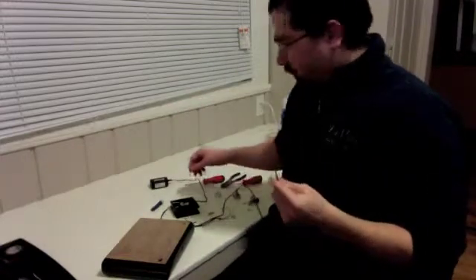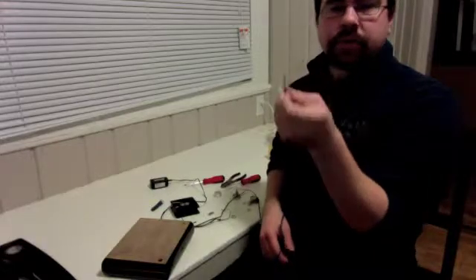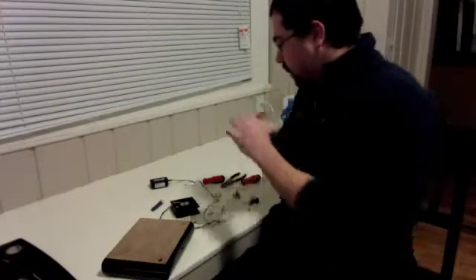You're just going to chop it off with wire cutters, and then you're just going to strip them either with a fine knife or a wire stripper tool. And then you're going to end up doing the same thing for your fan. Just like so.